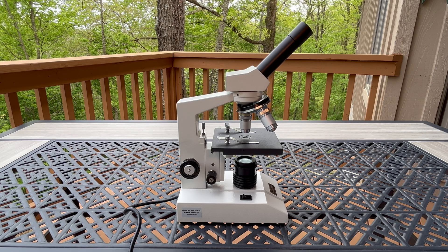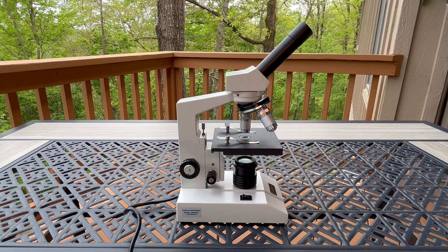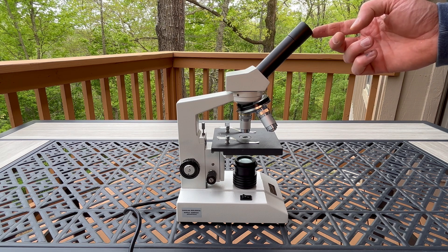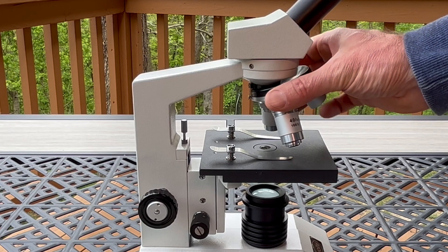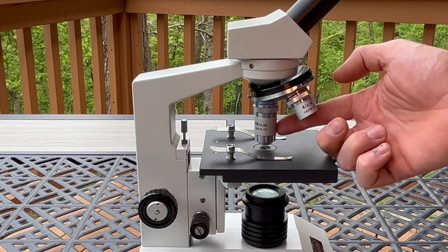Let's start with the name: microscope. Micro means small, scope means an instrument for seeing — it's a tool for seeing really small stuff. So what are the basic parts? Starting at the top, you have the ocular or eyepiece, which is attached to the body tube. Then we have the nosepiece, which is the rotating part of the instrument that has the three objective lenses attached to it.